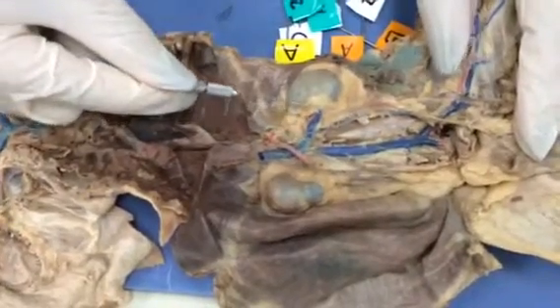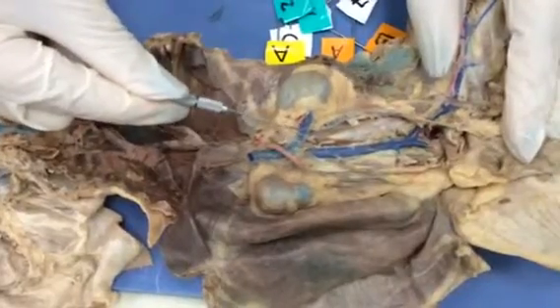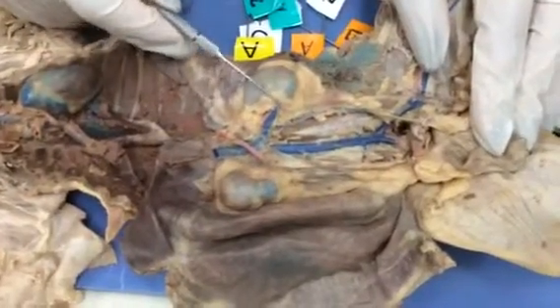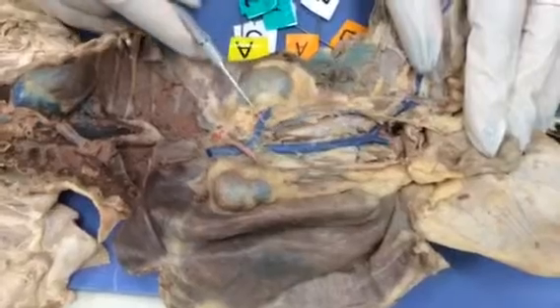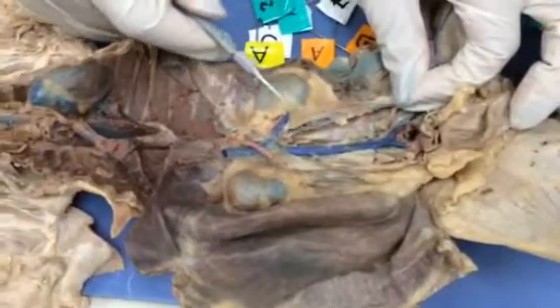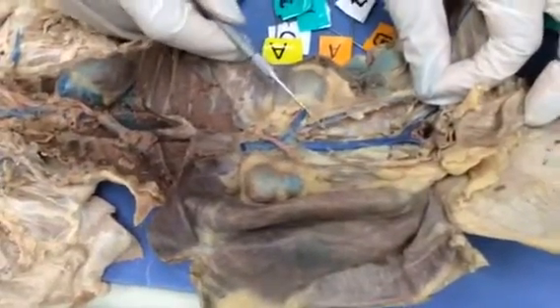This one, as you know, is going towards the kidney, so we call it the renal vein. The left renal vein. Now here we see an anatomical differentiation. The left gonadal vein drains into the renal vein. So these are the gonadal veins. If it's a male, we call it the spermatic vein. If it's a female, we call it the ovarian vein.